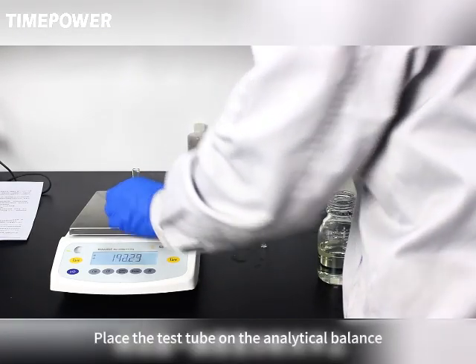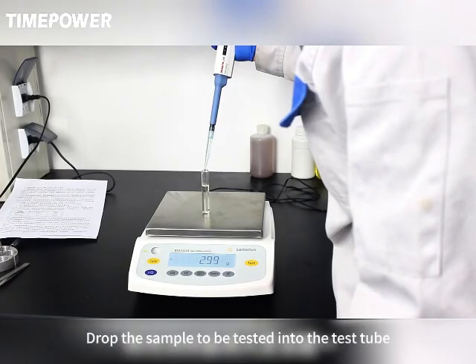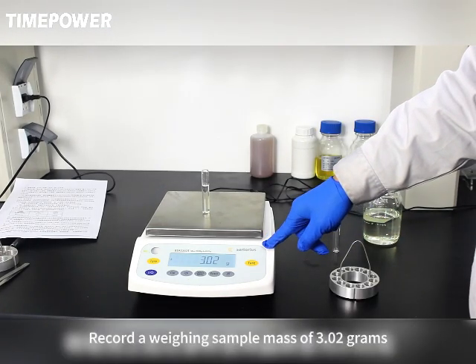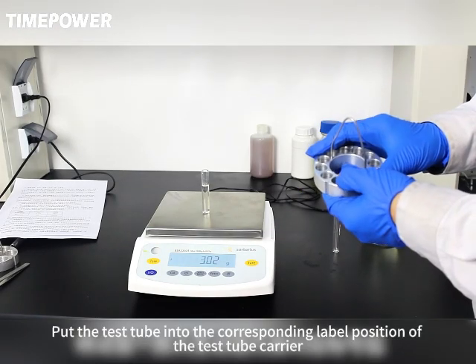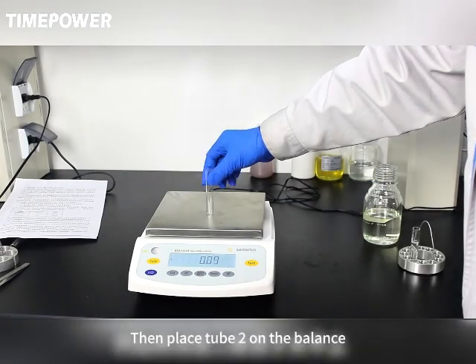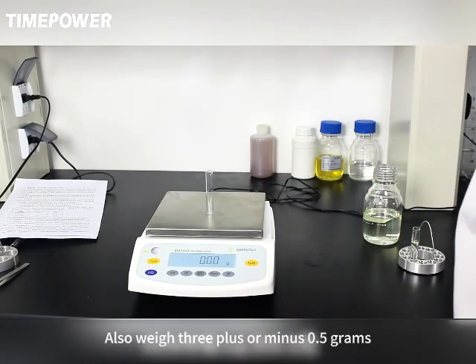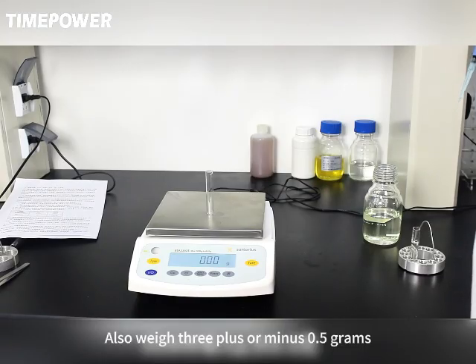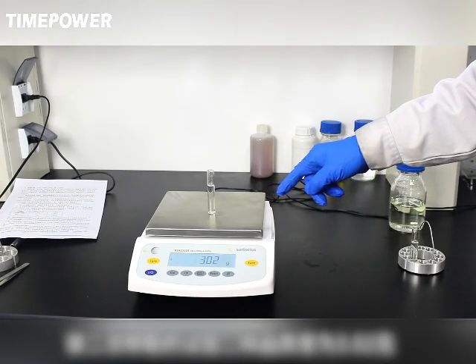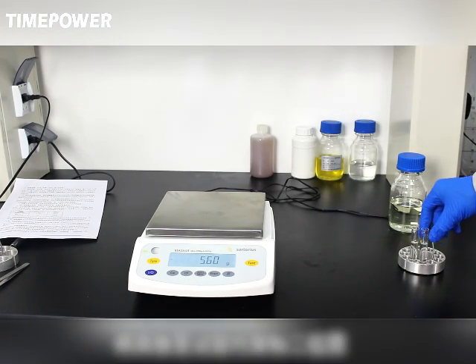Place the test tube on the analytical balance. Press the clear button. Drop the sample to be tested into the test tube. After weighing, record the sample mass of 3.02 grams. Put the test tube into the corresponding label position of the test tube carrier. Then place tube 2 on the balance. Zero its mass. Also weigh 3 plus or minus 0.5 grams. The sample mass of test tube 2 weighed the second time is 3.02 grams. Record its mass and place it in the corresponding position of the test tube carrier.